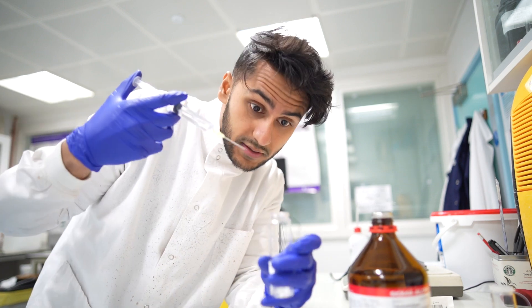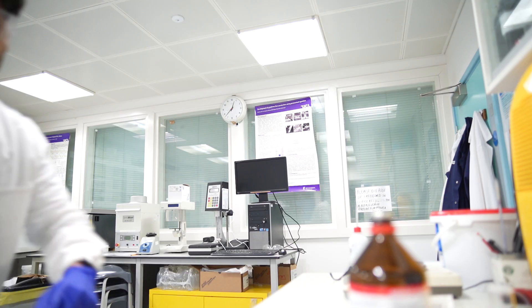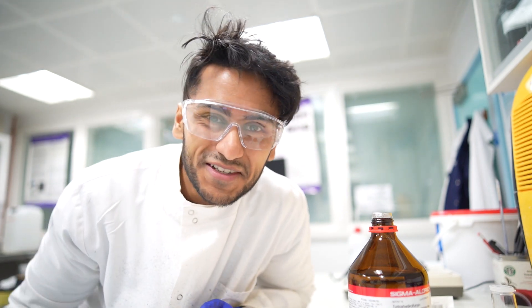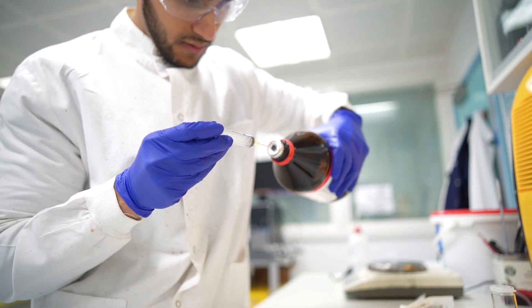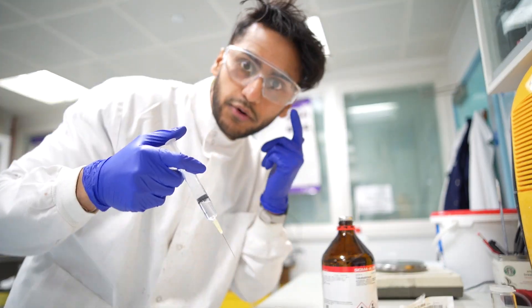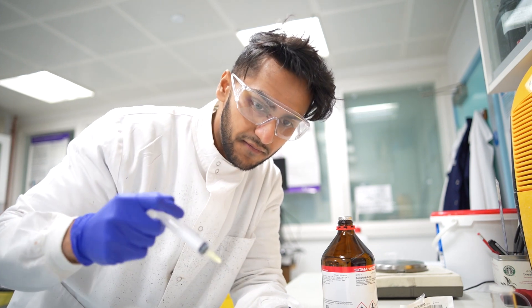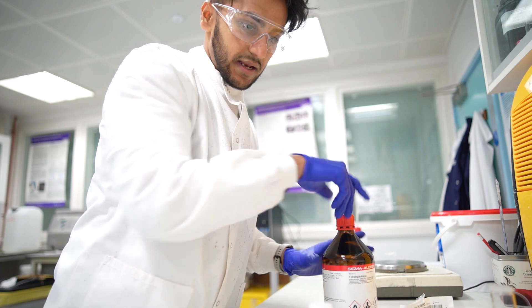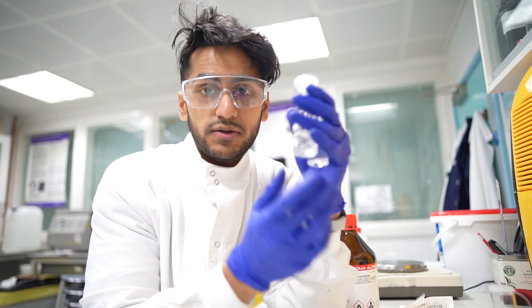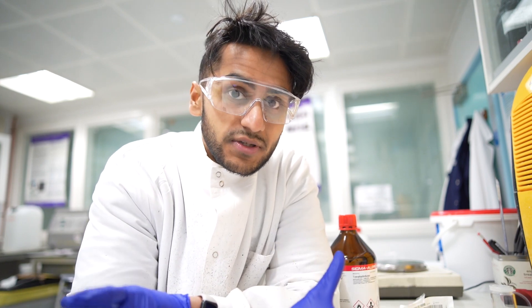The needle is not coming off, so I'm going to pour it straight into the solution. You need to be very careful — I should be wearing goggles, which I'm going to put on now. Another three milliliters into here — invert, poke, and pull. It's very important to wear goggles because whilst pushing the syringe, the pressure builds up and it can splatter everywhere. So it's very important to wear all the health and safety gear. And here we are — we have the second solution, which is THF with the thermoplastic polyurethane. I'm going to wait 24 hours until I spin them, just to allow the dissolution process to completely take place. Sometimes when using a speed mixer, it looks dissolved, but the polymer chains inside aren't completely dissolved.